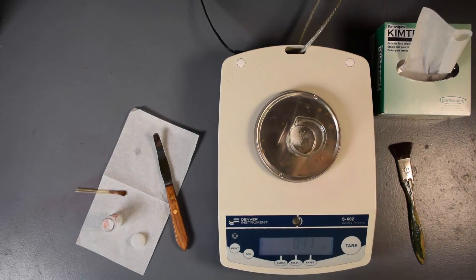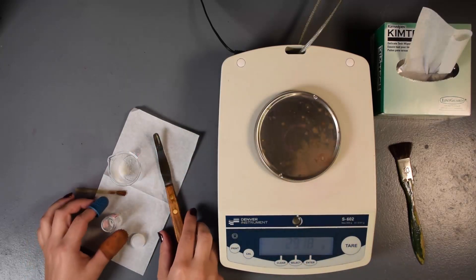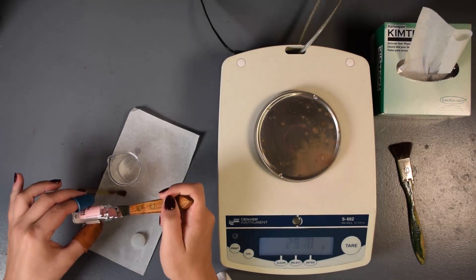The desired amount of compound is 0.5 grams and the balance reads 0.41 grams. Therefore more compound needs to be added to be within 10% of the desired amount. Remove the container from the top loading balance and add more compound using the same careful quantitative transfer techniques.